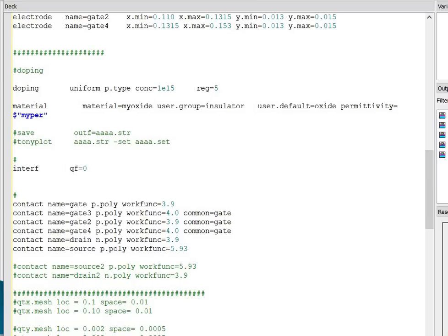Next is specifying the interface property. The interface statement is used to define the interface charge density and the surface recombination velocity at the interface between semiconductor and the insulator. For example, the statement QF is 0, I have taken. You can take any value of the charge density: 1E10, 2E10, 3E10, 4E10, 5E10, 1E11, 1E12 per centimeter square.